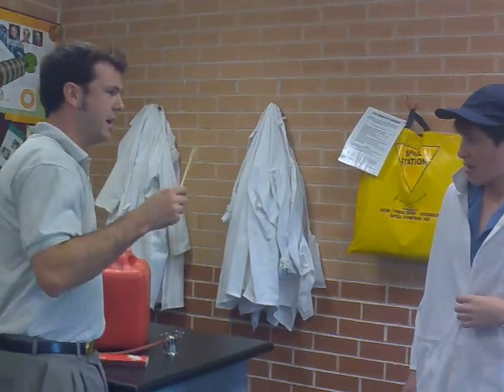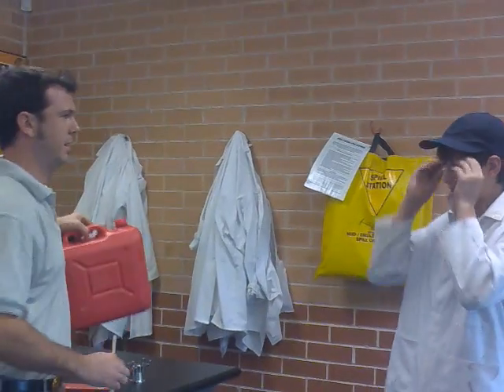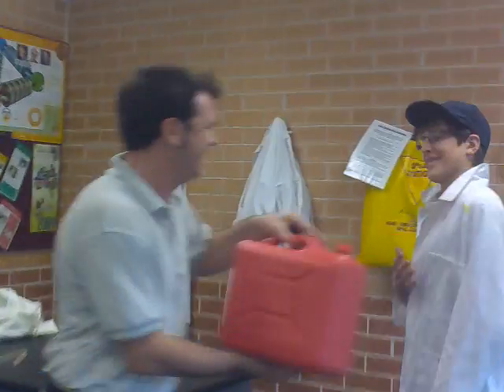Now, Tom, there's going to be a live flame involved here, so you might want to put your glasses on for safety. I don't think he's safe, sir. He doesn't know what he's talking about. Okay. Now, we're just going to splash a bit of petrol here and there.